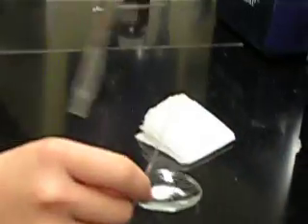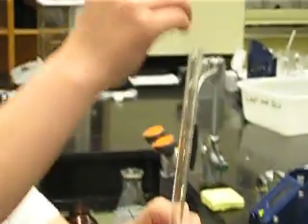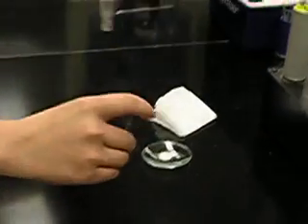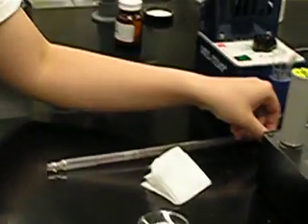But if it doesn't do so, then you want to take the graduated pipette and just drop it down like this. That will ensure that all your sample has fallen down to the bottom of the capillary tube.